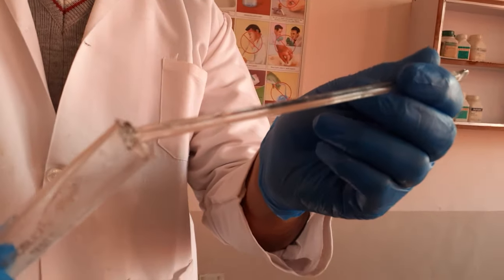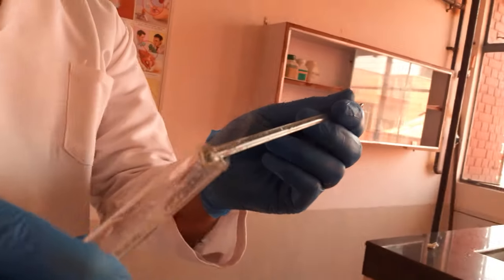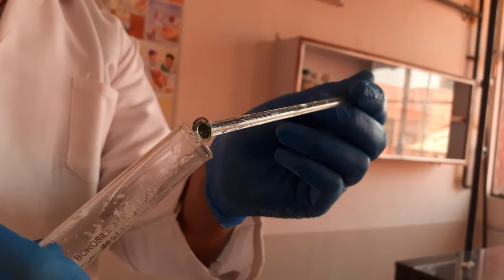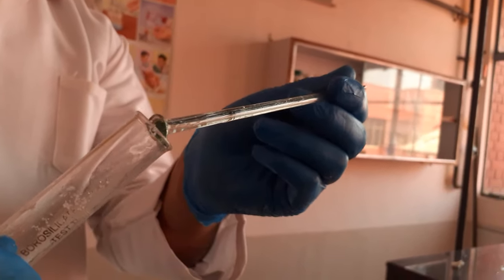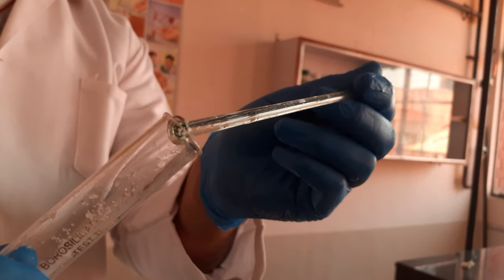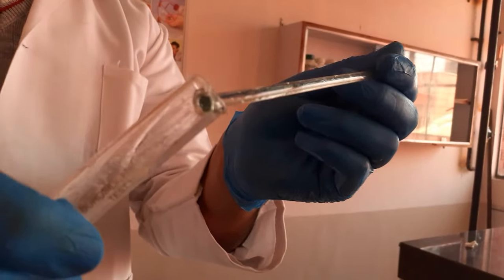It is not clearly observed — there are faint white fumes if you can see. But this can be better illustrated if we use a burner and slightly heat the contents.